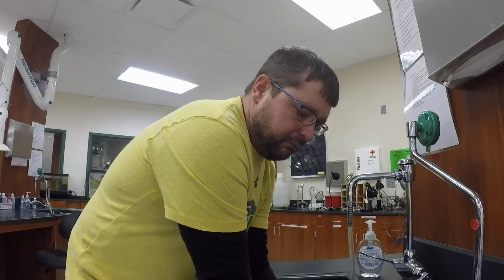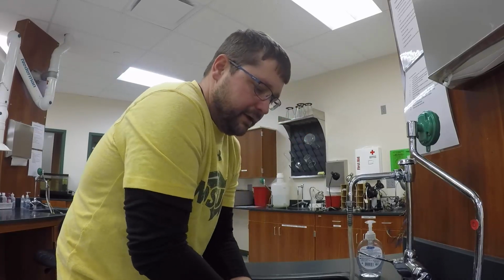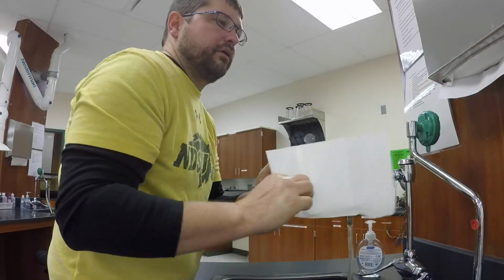And make sure that I'm washing all the parts of my hands, not just concentrating on washing the 2 fingers that I scrubbed onto the nutrient dish. But I'm going to wash it. And so I said a minute, but really 30 seconds is plenty. Okay. I'm going to dry them.